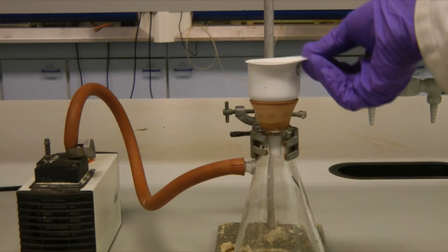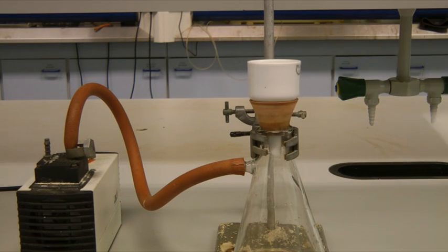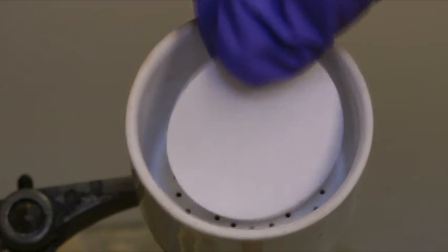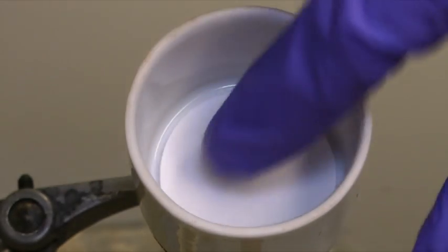Then make sure you've got the correctly sized filter paper for the funnel. This should fit over the holes inside the funnel.